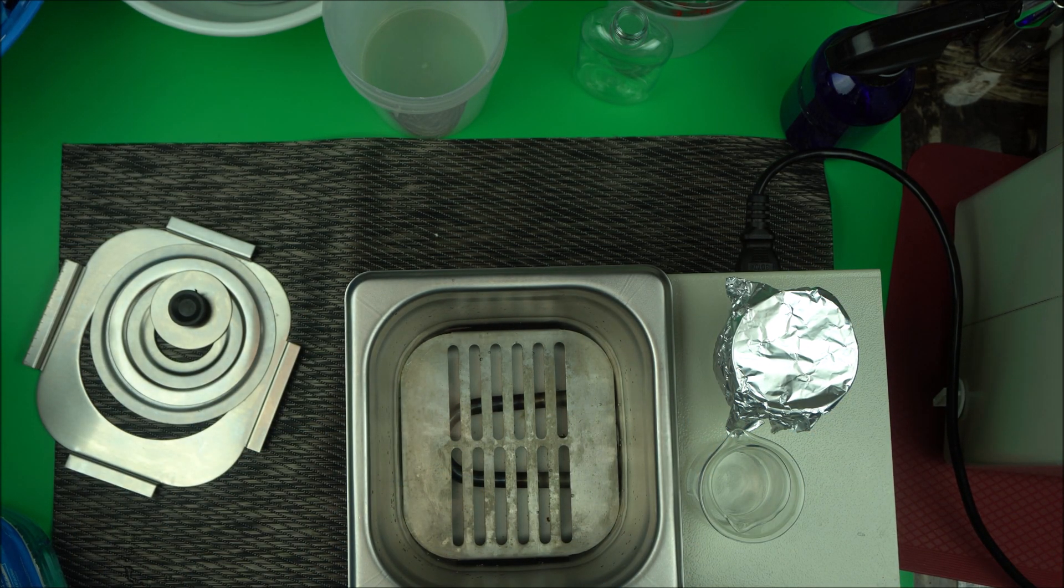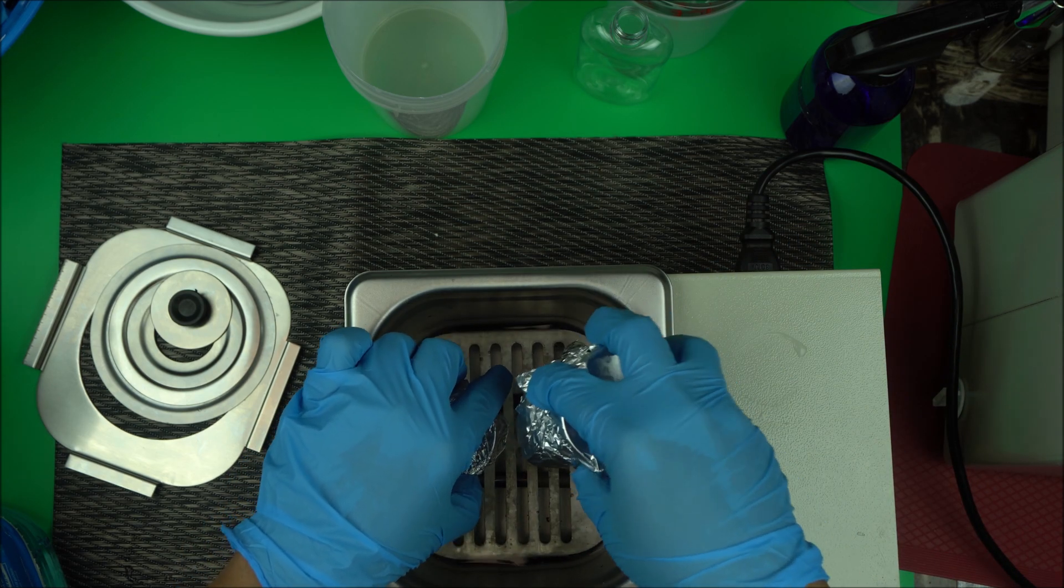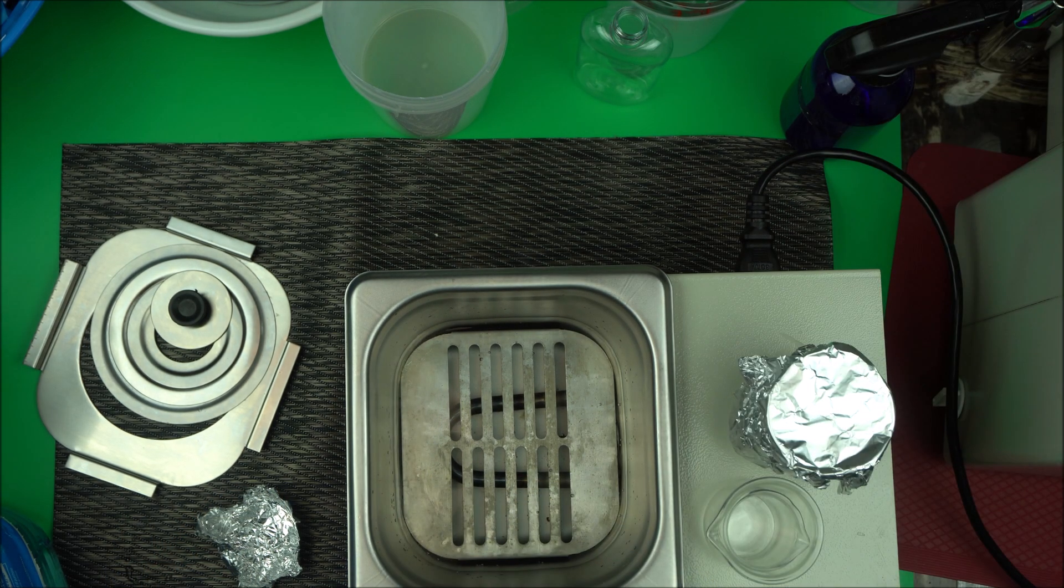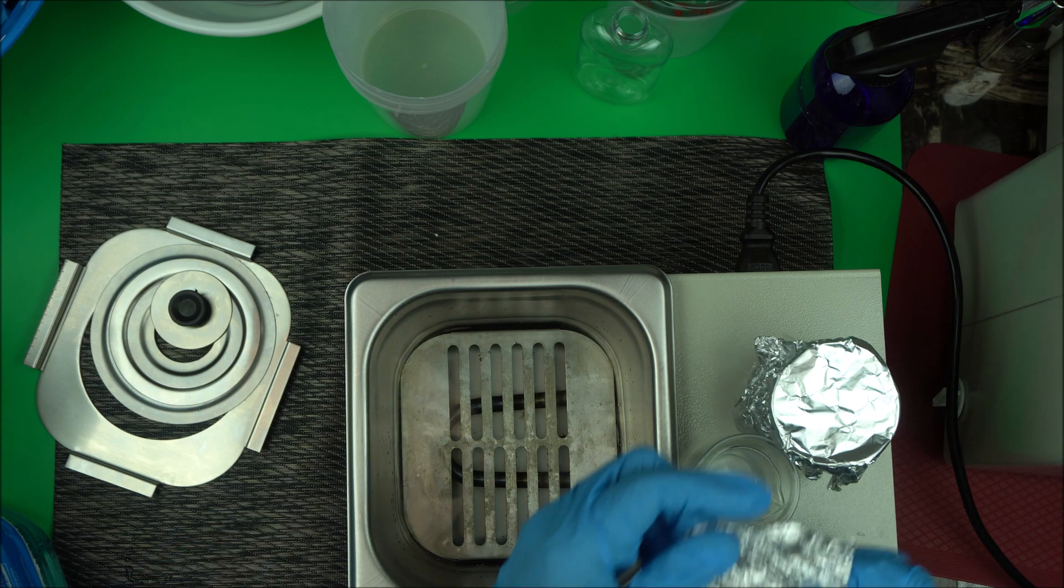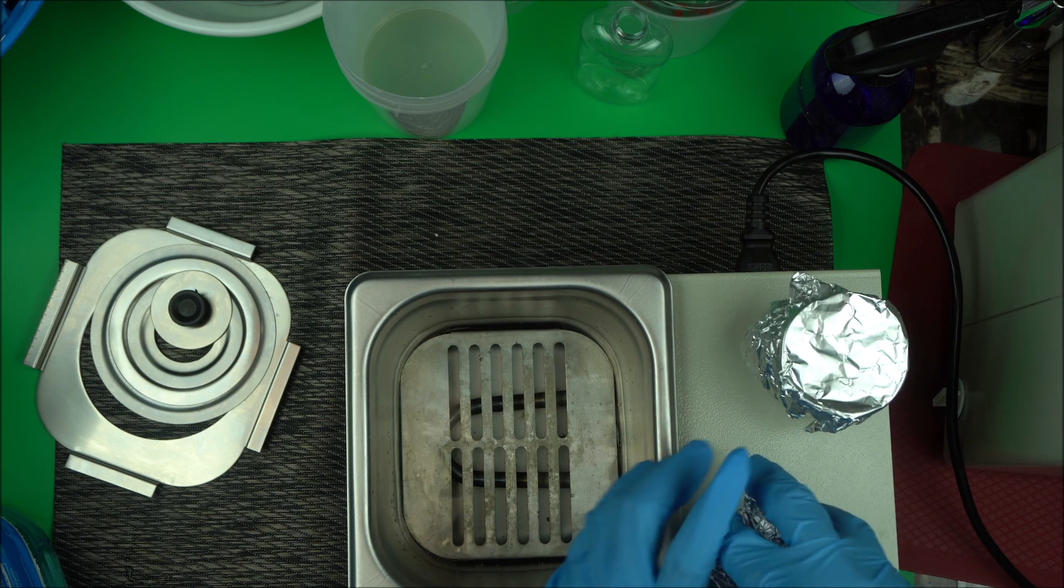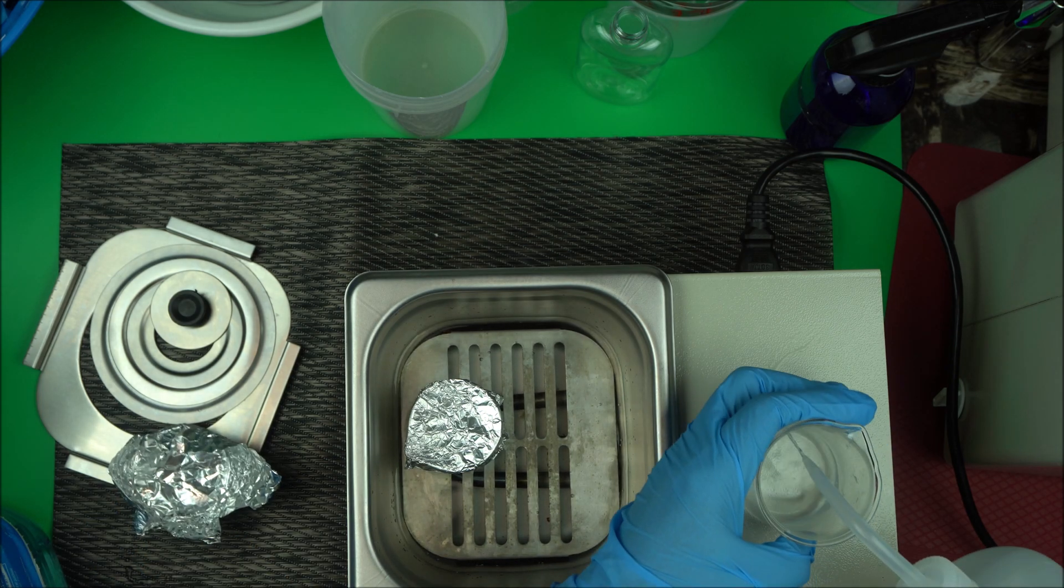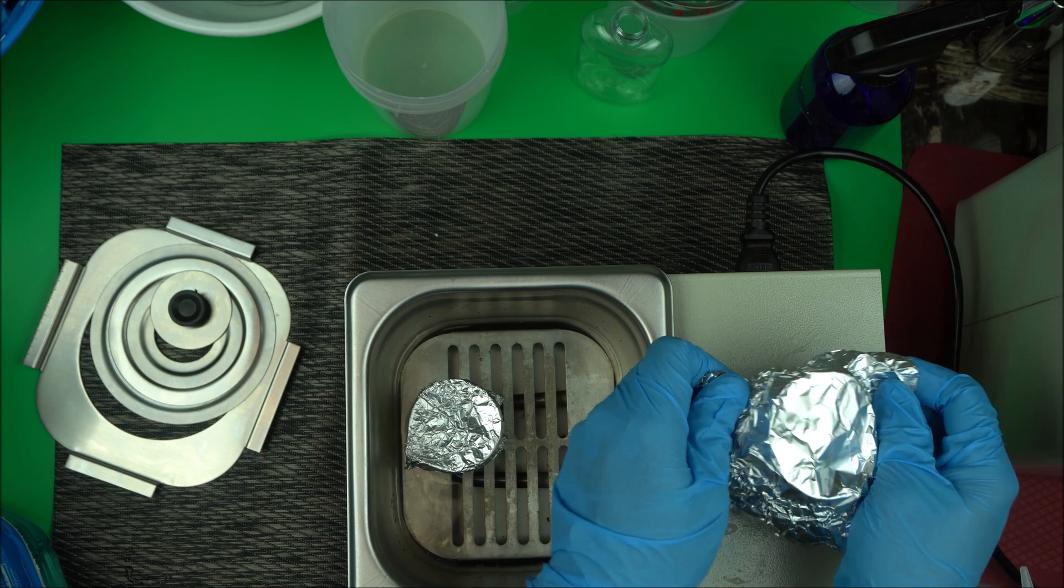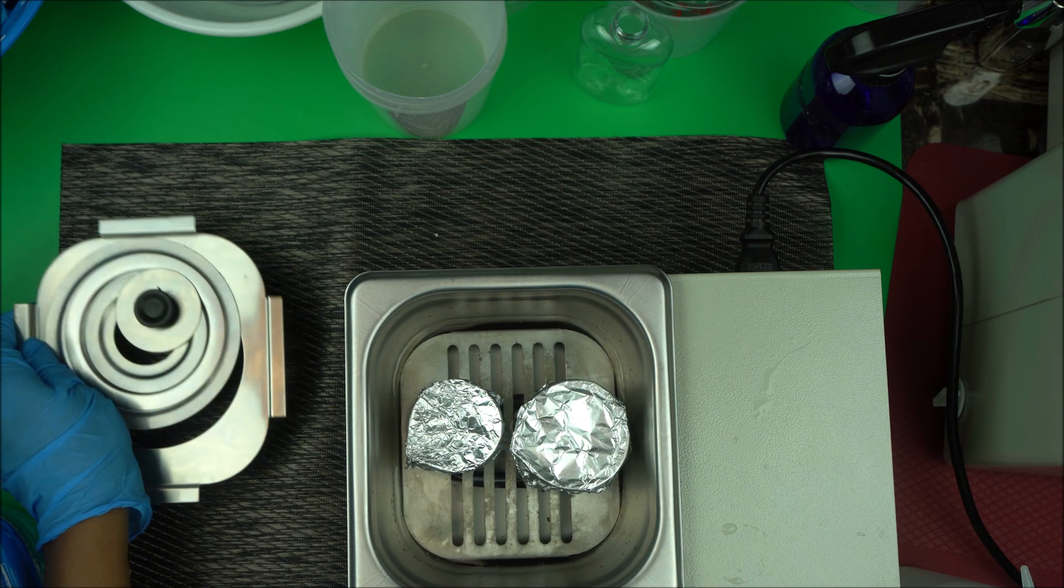Put your ingredients in different beakers. I'm going to do a video shortly where I'll be using the water bath and show you how that is done. Put both in your water bath, then you cover it.